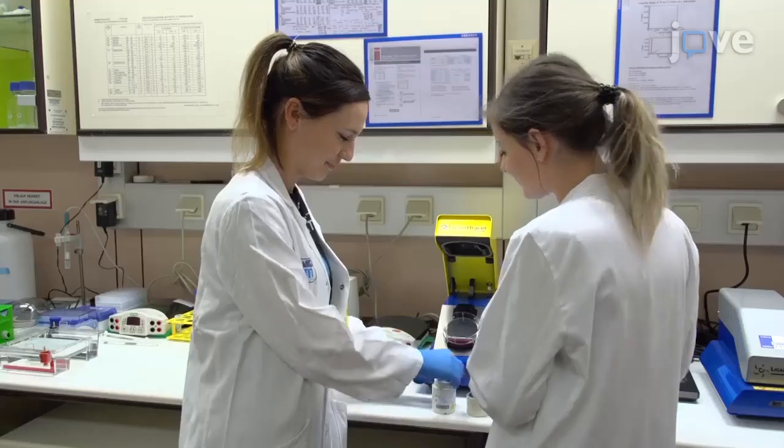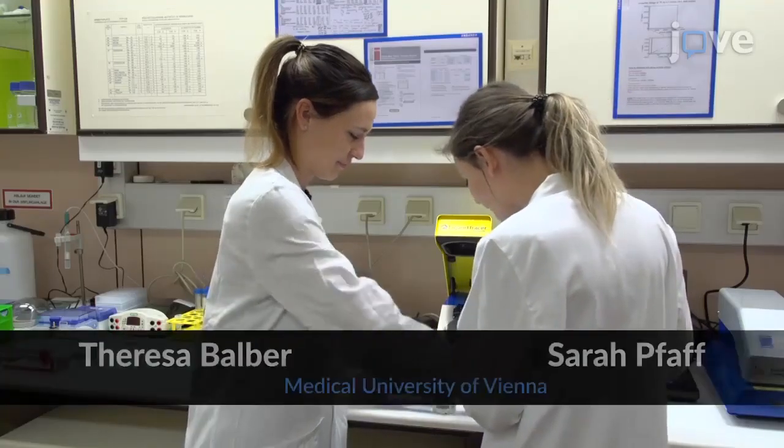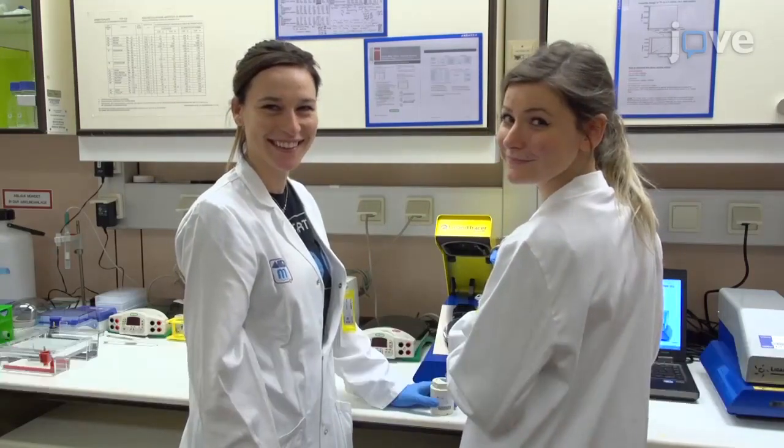The automated radiosynthesis of SNAP is broadly applicable to radiolabel low molecular weight compounds with an easily accessible methyl group. Once established, this procedure can be adapted for other compounds. Assisting in the demonstration will be senior PhD students Sarah Pfaff and Teresa Balber.